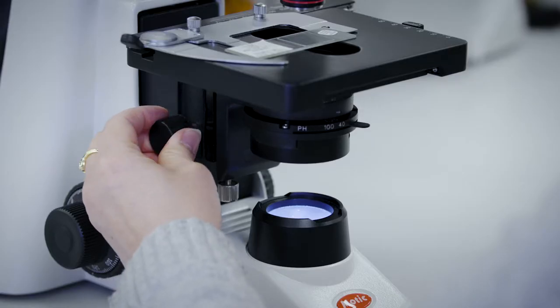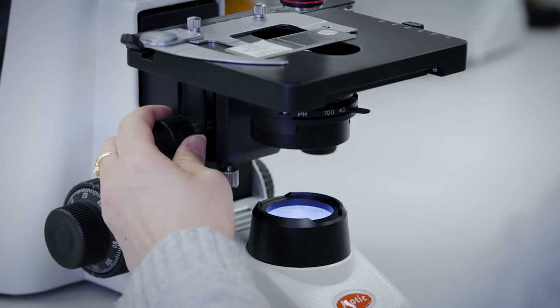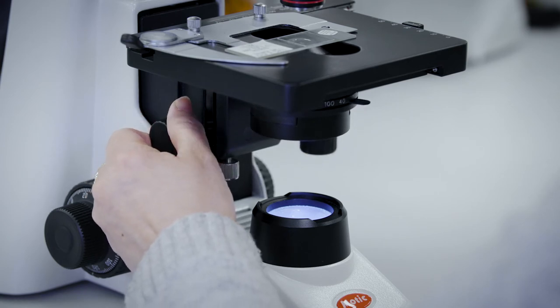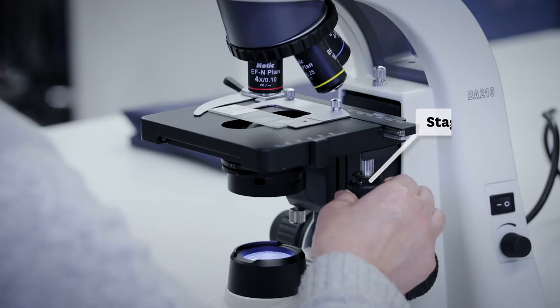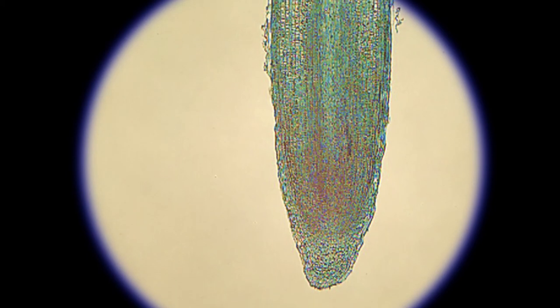The condenser is used to focus the light from the light source onto the micro slide. It should be placed at the top position for most of the slides. Use the stage knobs to position the sample in the centre field of view before changing the magnification.